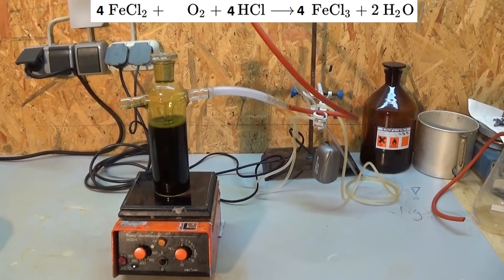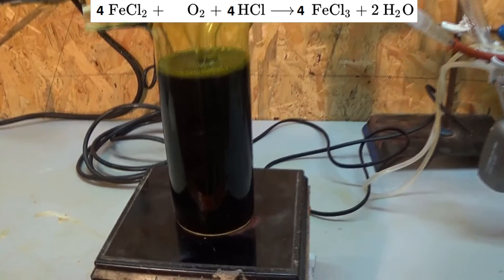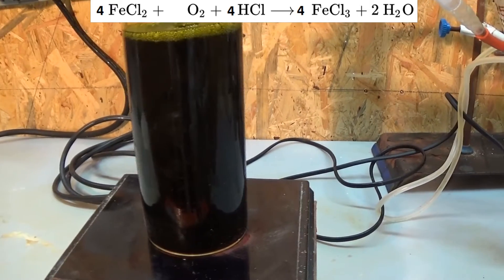So at first I came up with the air oxidizing apparatus to save chemicals again. I am so cheap. But this took forever.